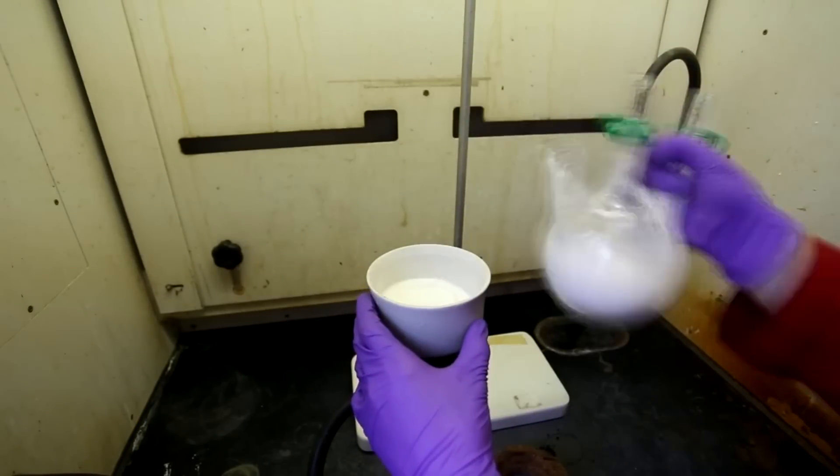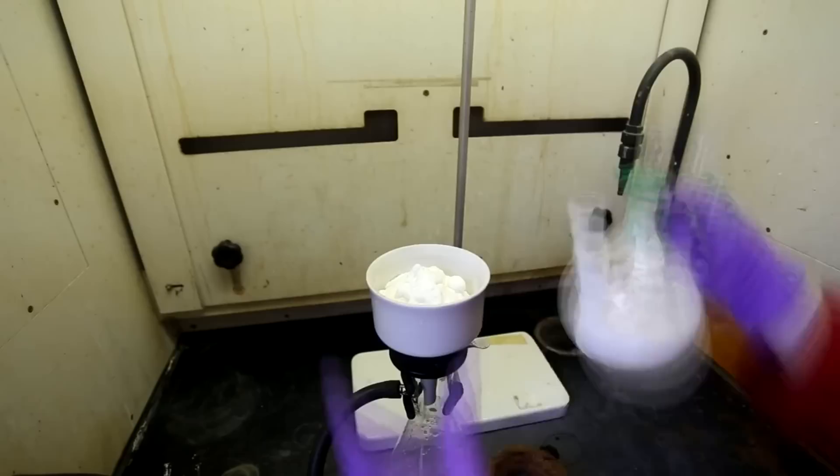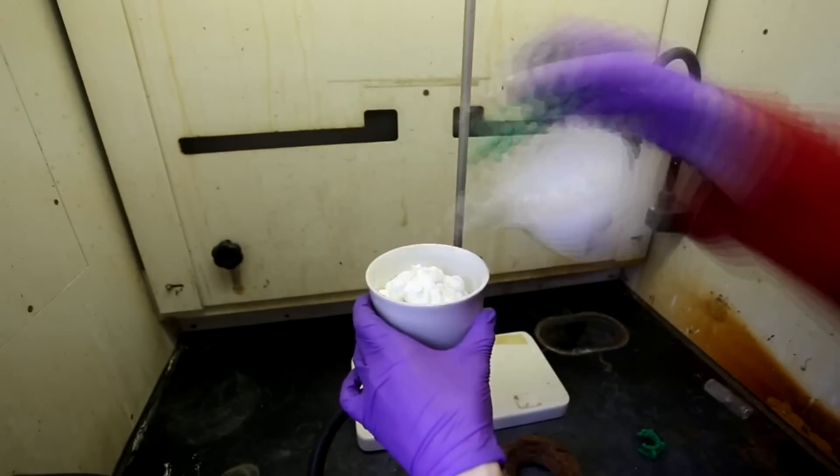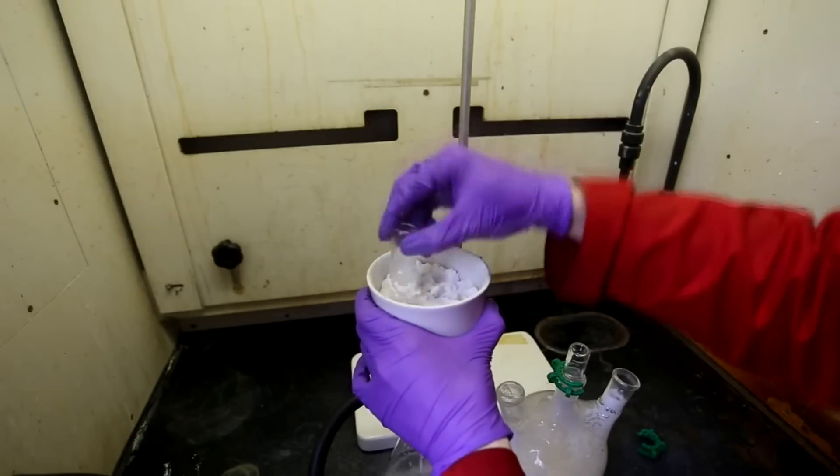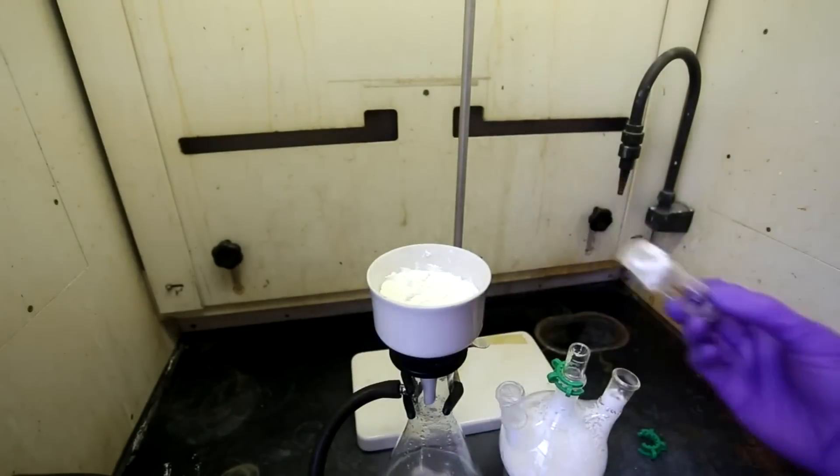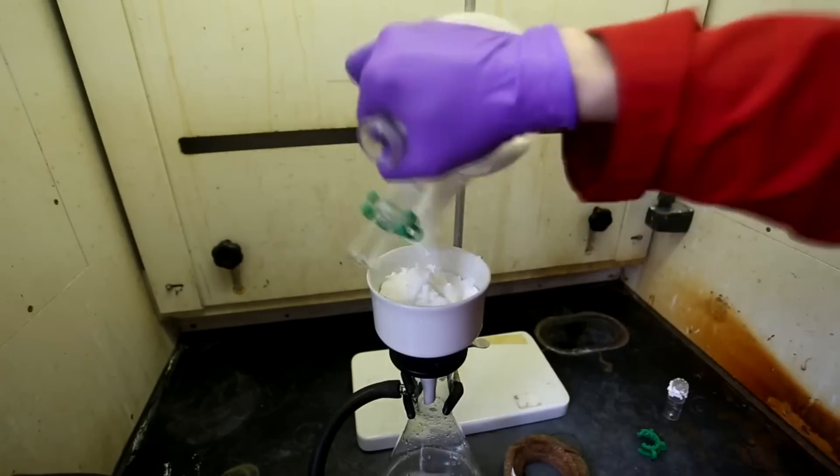The salicylic acid precipitate was then vacuum filtered and the precipitate was occasionally packed down to make it more compact. However, even with the packing, I had so much precipitate that I had to empty the Buchner funnel once or twice. Each time the Buchner funnel was full of product, I washed it once using 100 milliliters of cold water.